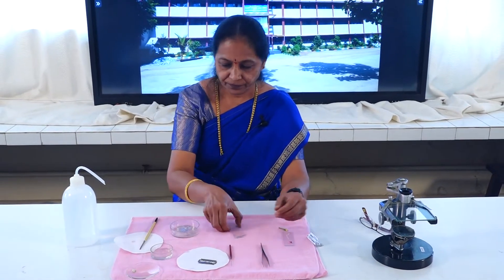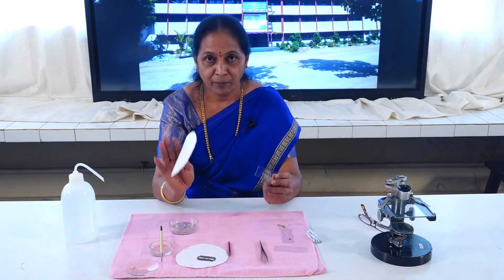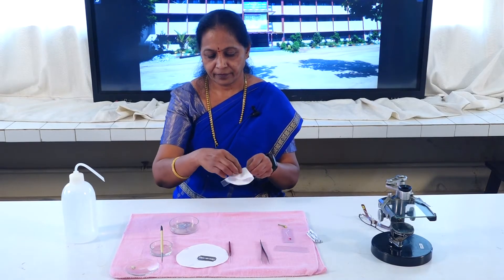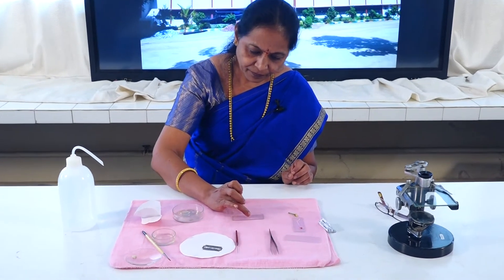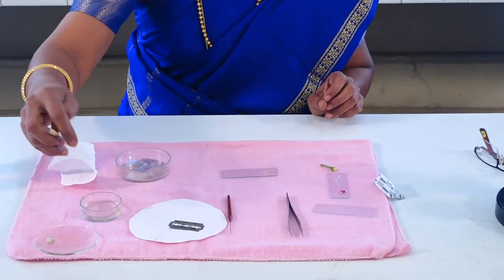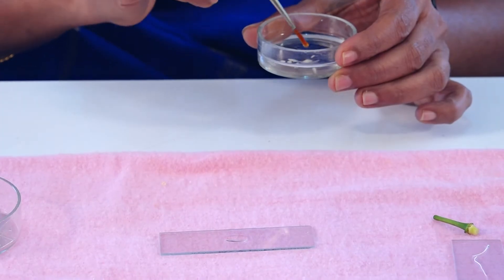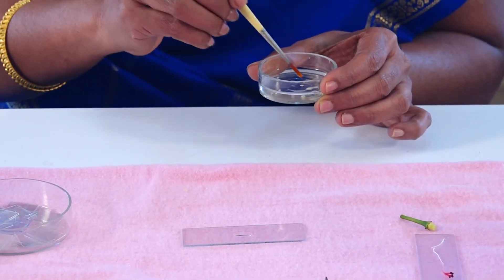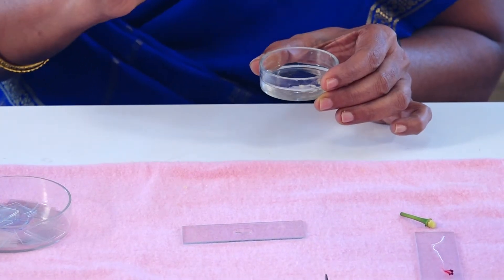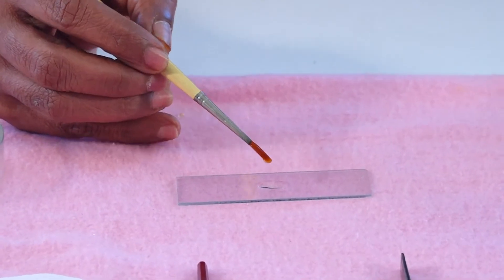Now the next step is the mounting. Wipe the slide with the help of the blotter. Put a drop of water exactly in the center of the slide. Now transfer the section to the water on the slide.